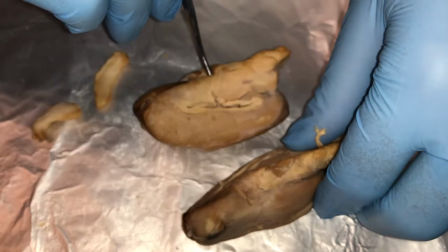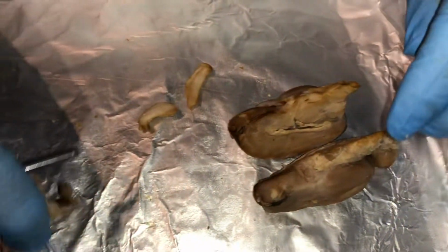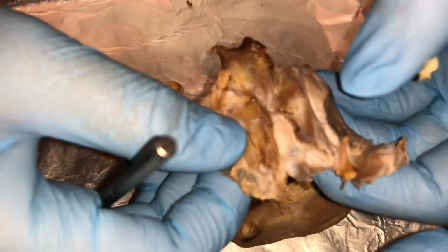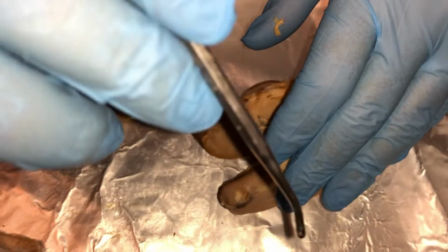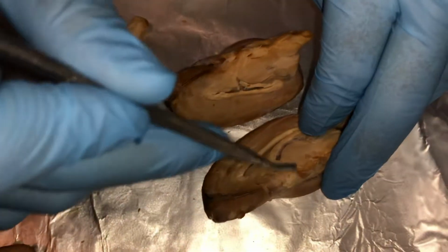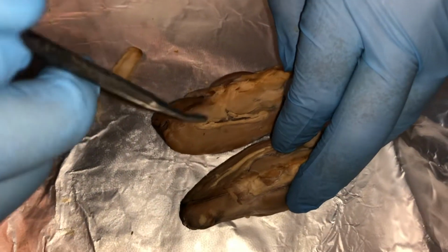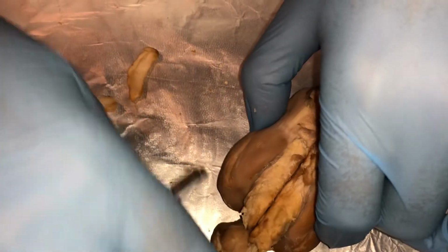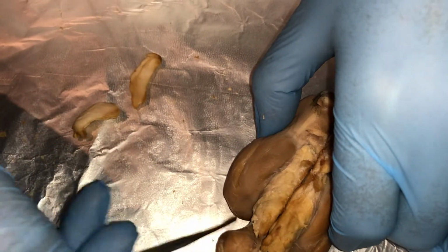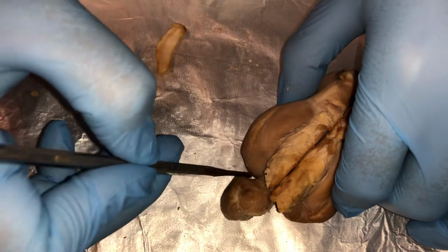Unfortunately, only one of mine is visible. Next is the optic chiasm, which are located on the sides, which would then connect to the optic nerve. Next is the optic tract, which is obviously around the optic nerve. Moving on to the oculomotor, located right here, here. Next is the trochlear, which is slightly visible. It would be located in this area.